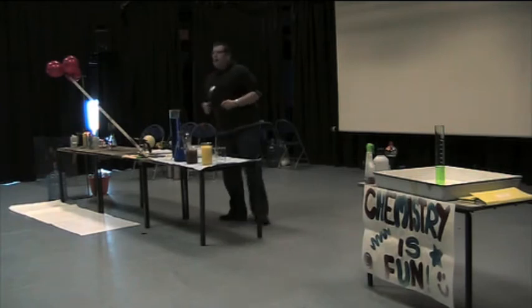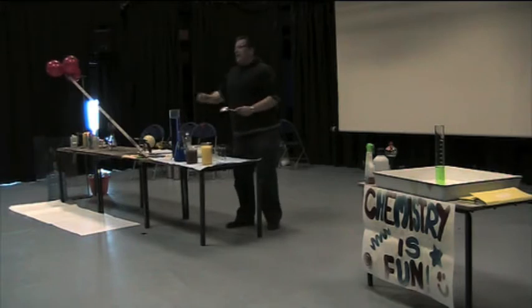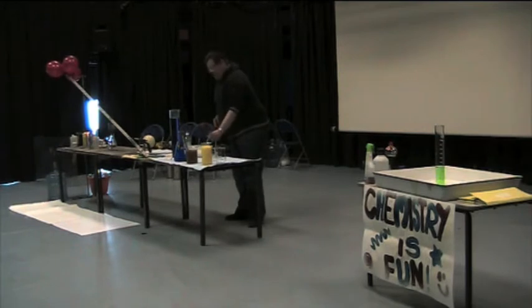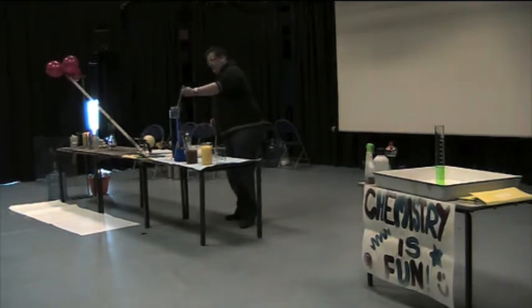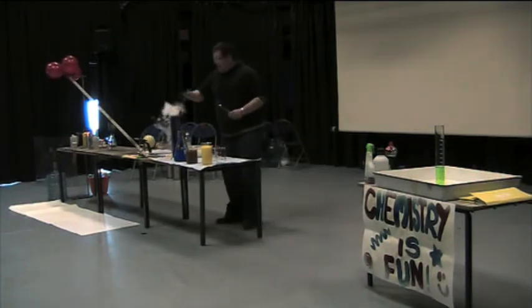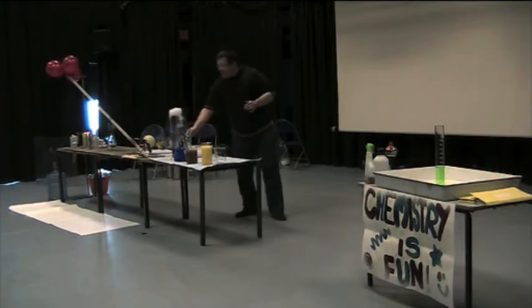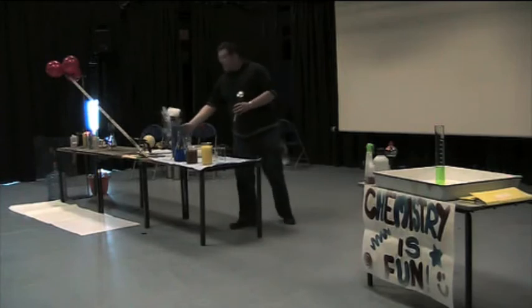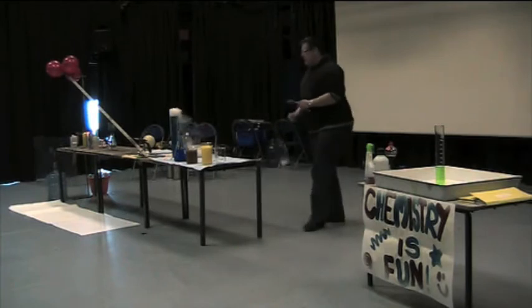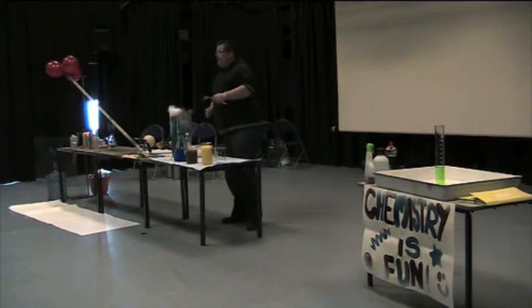Here is an alkaline solution with some universal indicator in it. A universal indicator in alkaline solution is this beautiful purple colour. So if I put some dry ice into this, what you'll find is, first of all, it creates a BBC science programme. Every time the BBC make a programme about science, they always have these in the background. But what's going to happen is the acidic gas is going to dissolve in the water, and as it does, it's going to change the pH. So hopefully, you can see the colours beginning to change as the solution becomes less and less alkaline and more acidic.